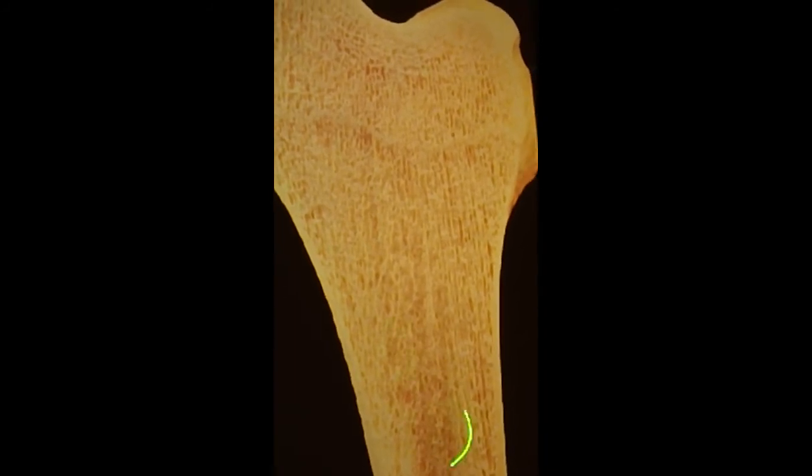This is an exquisite micrograph. It looks like the distal end of the femur. You can see on the edge here compact bone, right? Coming around, this would be the articular surface, compact bone. Here you can see nicely the trabecular, cancellous, or spongy bone, right? A bunch of interconnected bone spicules with spaces between them. And those spaces in real life would be occupied with marrow, okay? Down here you can see how the marrow cavity has begun to be hollowed out.